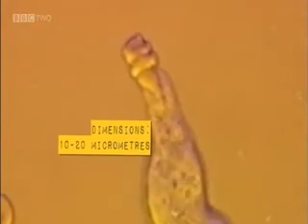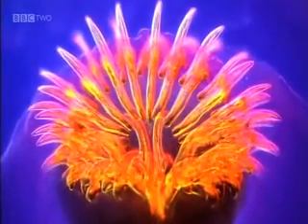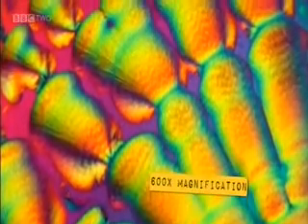Here's an amoeba engulfing red blood cells, and red and white blood cells moving through a tiny blood vessel, and human sperm, a leaf surface at 600 times magnification, and the head of a dog tapeworm no bigger than a grain of rice. Plant cells crammed with chloroplasts. And look at these glucose crystals.